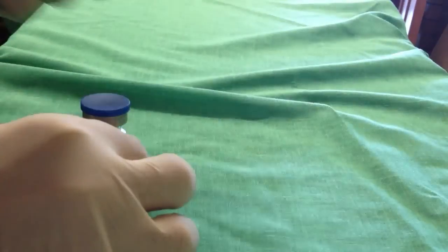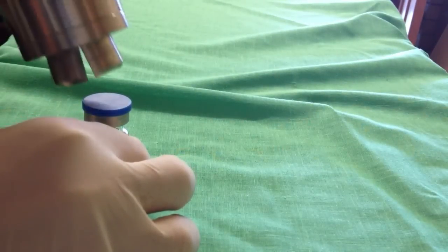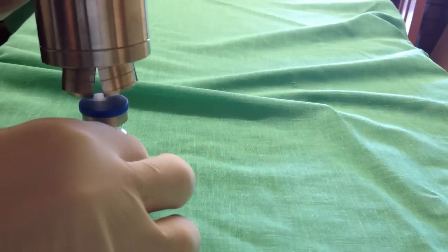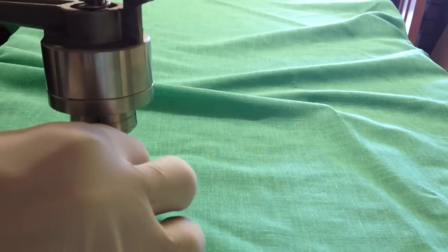Once that's level, you get the crimper and then just squeeze it tight.